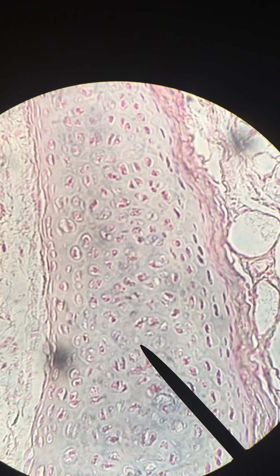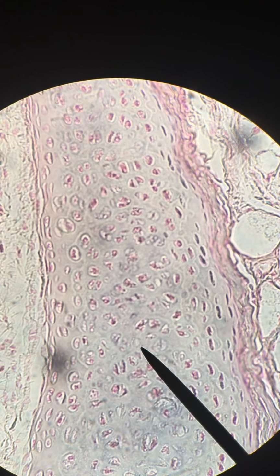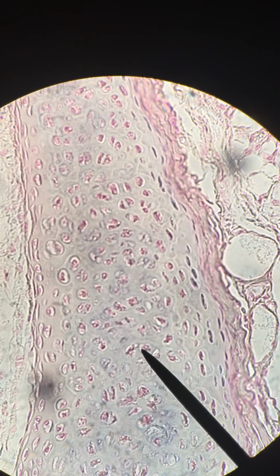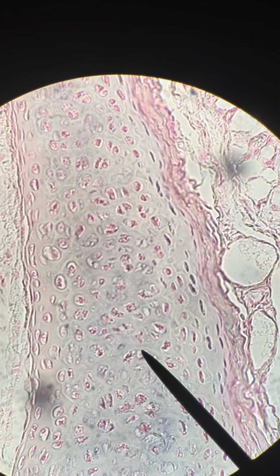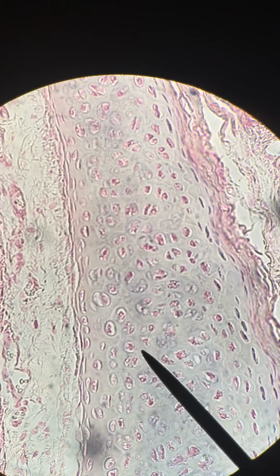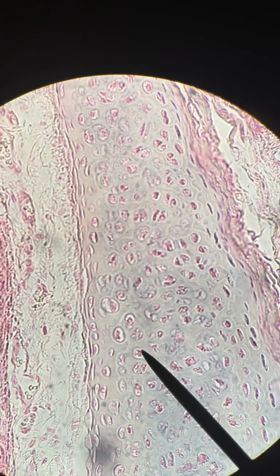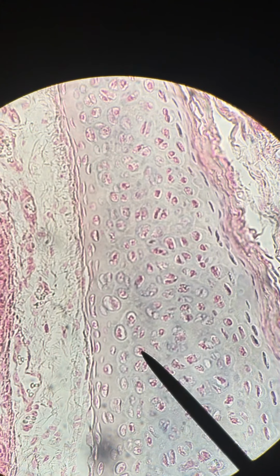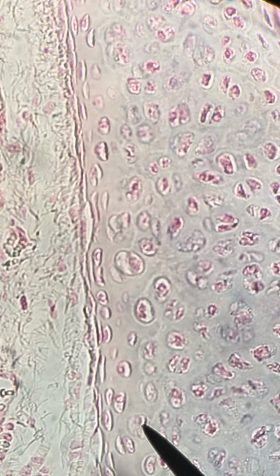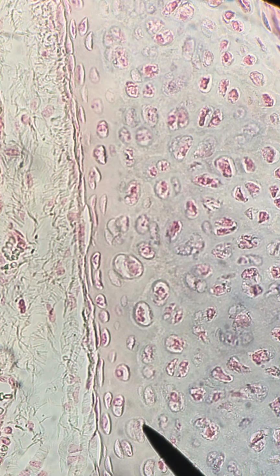And sure enough, here we have our hyaline cartilage. Okay, so cartilage is going to have chondrocytes in lacunae. So each of these little cells here is a chondrocyte in a space called a lacuna. You can see there's like a little bubble around some of these. And this is our highest power for the microscope. I'm going to use my phone to try to enlarge that a little bit more so you can see that. There we go. Okay, so you can see there are chondrocytes in the lacunae.